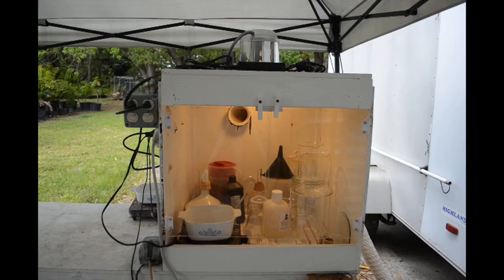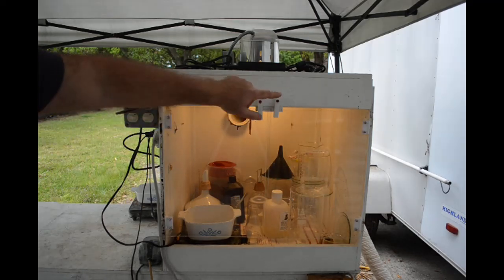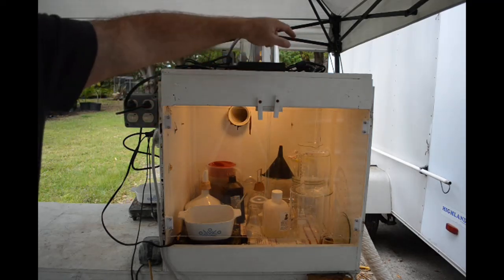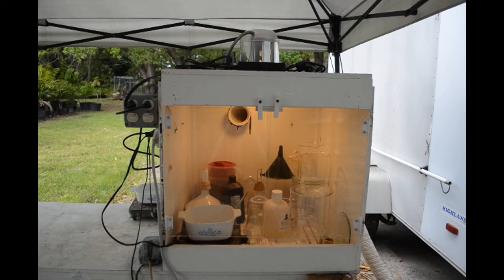One thing I did wrong back in the beginning when I put the original lighting in was I put LED strip lights around the sides on the inside. Yeah, that worked for a couple weeks and then the chemicals just totally destroyed the strip lights. That was just a disaster. I had to go without lighting for a while.